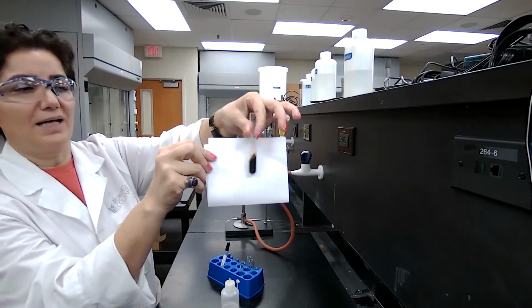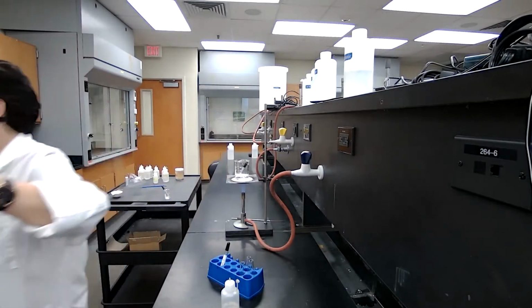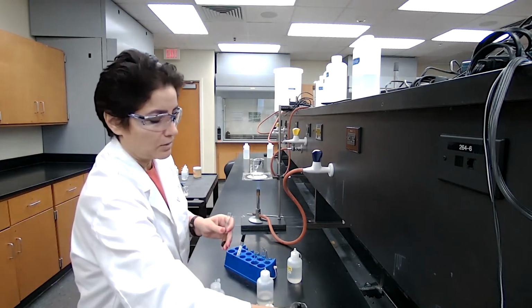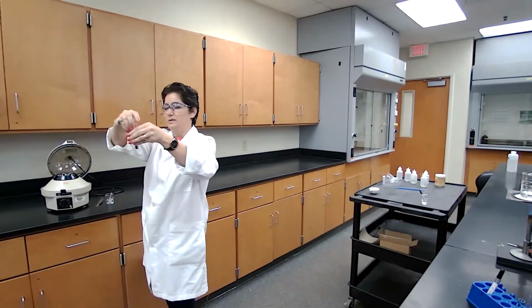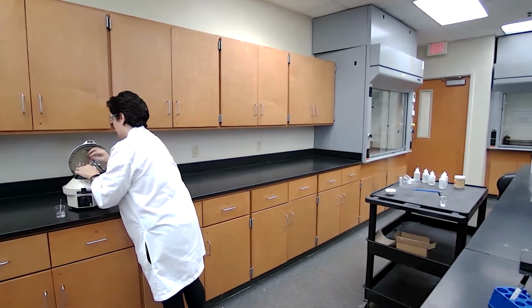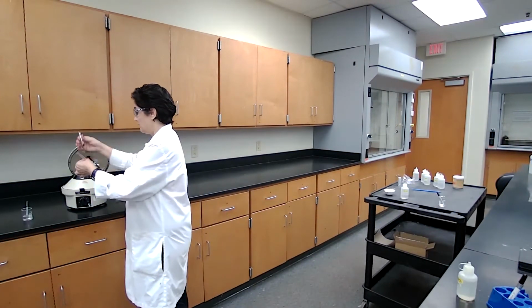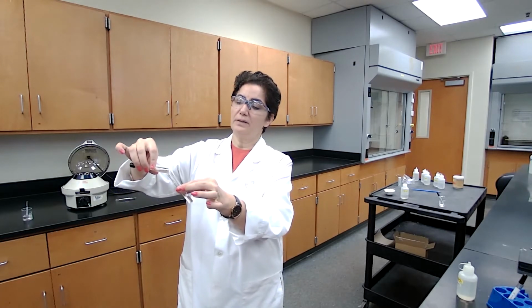In the next step, I need to centrifuge the mixture to separate the centrifugate. And you will be recording your observation based on the color and what is happening on the following steps. Level of the liquid, you just want to make sure that is the same on both test tubes. And start the centrifuge. Okay, centrifuge is done. I'm going to take the centrifugate and transfer it into test tube labeled B.